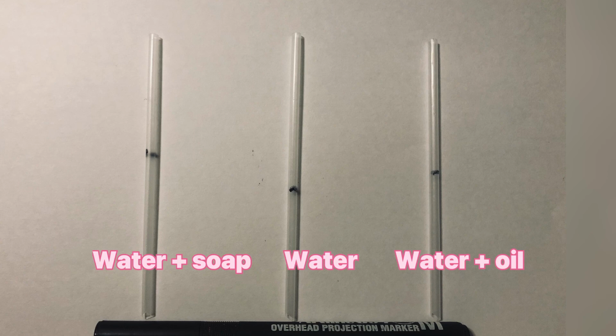So, it turns out that in the comparison of the three solutions, the highest is the solution of water and soap. It is because the soap in the water has a function as a surfactant that can reduce the surface tension, so that the water can rise higher than in the plain water solution and the mixture of water with oil.